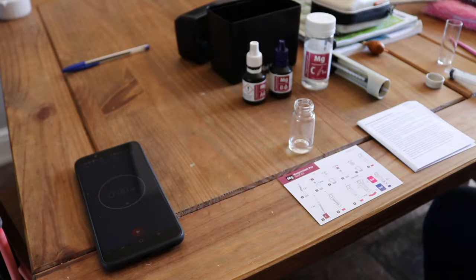The reason for this video is because there seems to be a lot of confusion around the Magnesium Red Sea Pro test kit, and I went around YouTube, forums, and general internet searches, and found various bits of information that I ended up needing to know. And they weren't all in the same video.